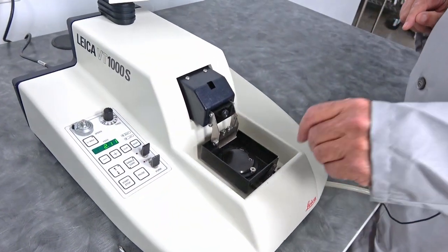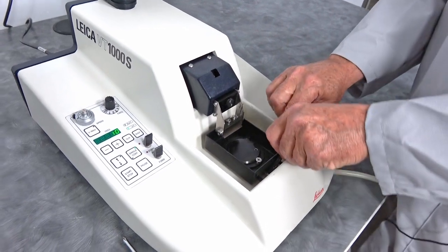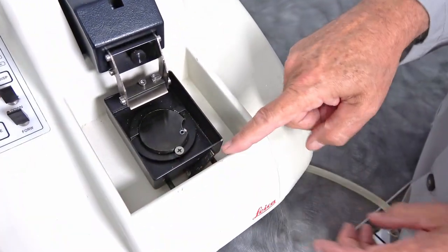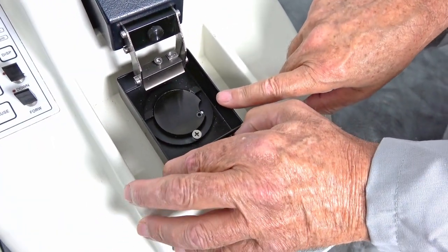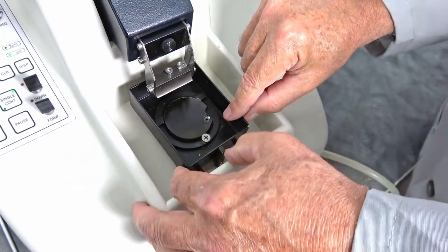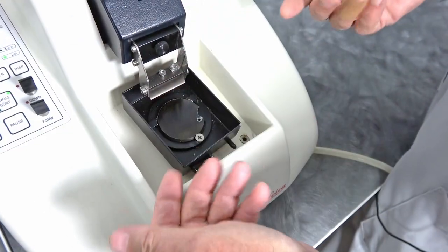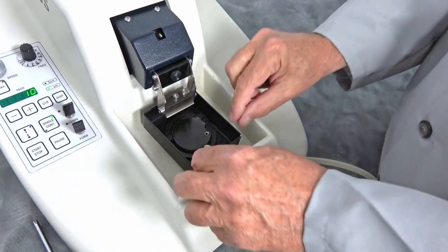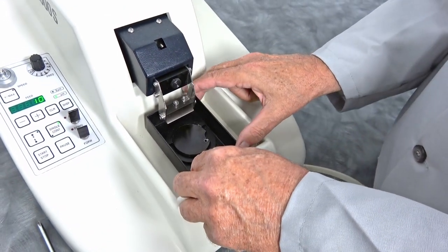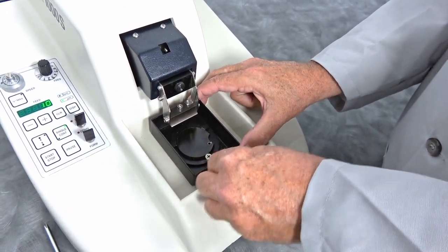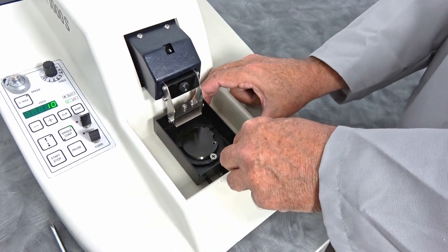The unit is ready to lock. I did forget to mention this cavity is removable. There's a lever there. And that will come out. It can be lifted out when you don't have the blade in place. That's why it's often missing when we get them.